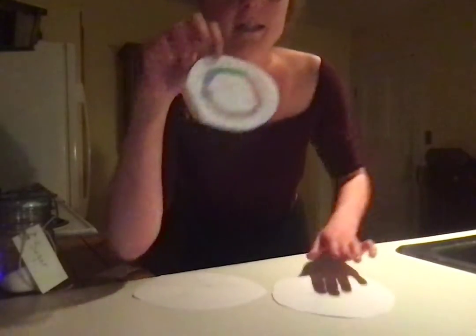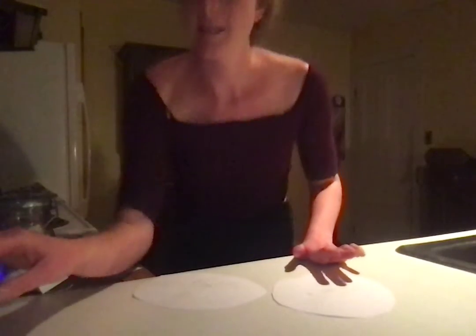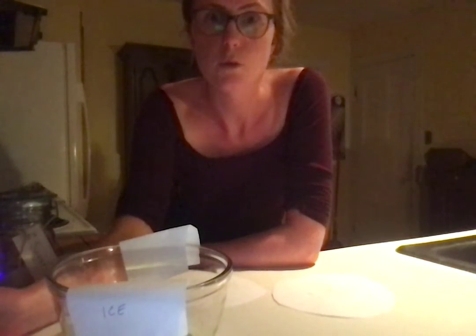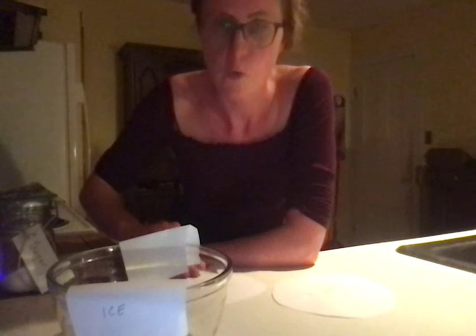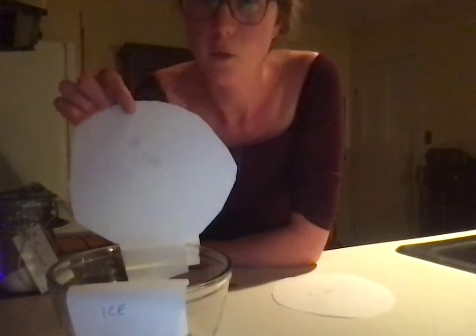To achieve this, to make our E. coli cells competent, we want to get an ice bath right here, and we want to add calcium chloride to it. By adding calcium chloride, the goal is to neutralize our negatively charged DNA so that it is more able to easily pass through the membrane of the E. coli, the cell membrane.